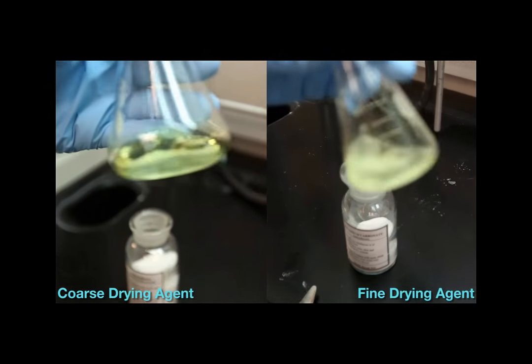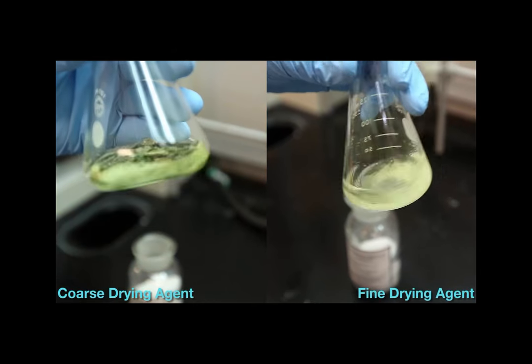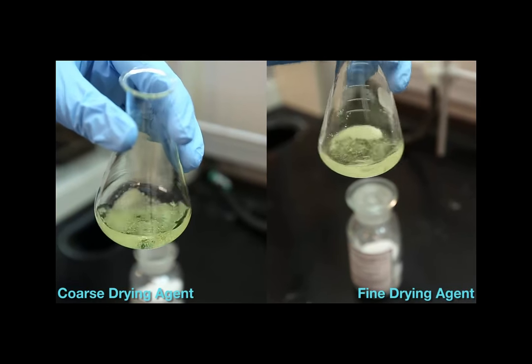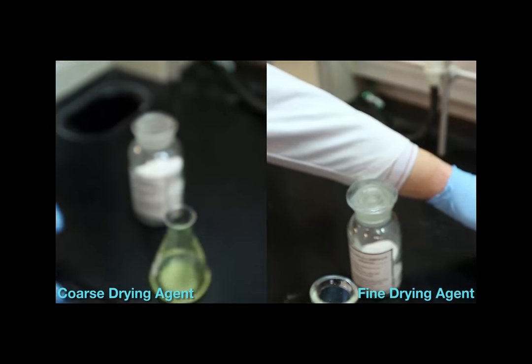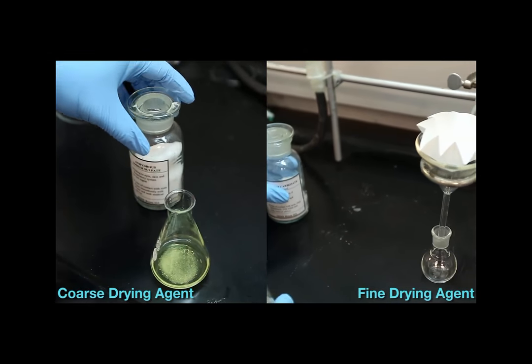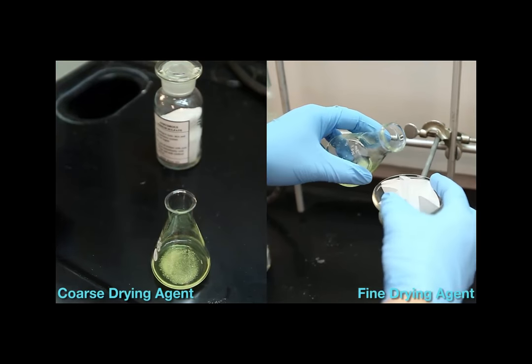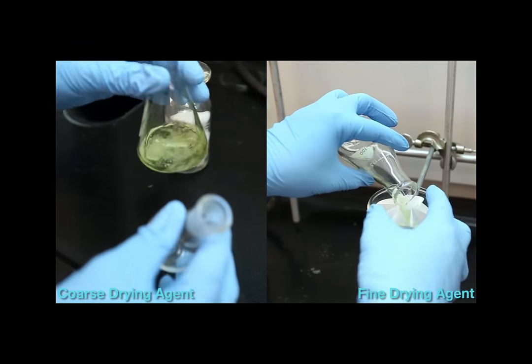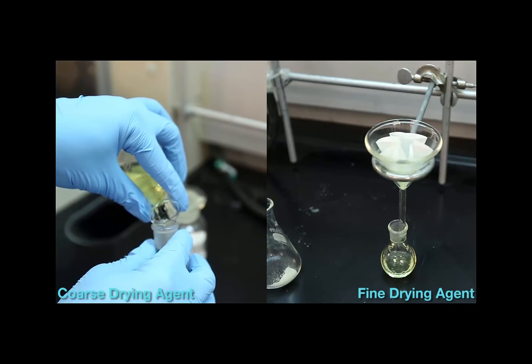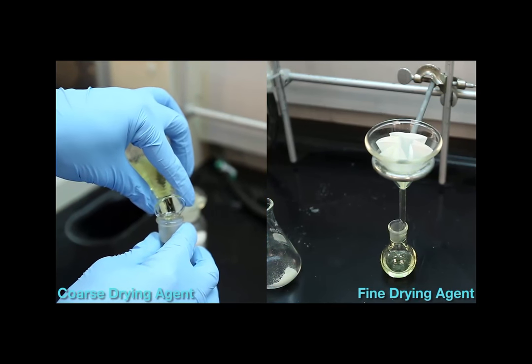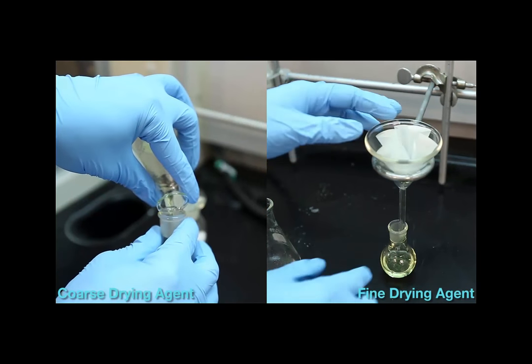Add the drying agent in, in small increments at a time. The drying process is complete when the drying agent no longer clumps. There are two precautions one needs. One, be careful not to add too much drying agent since it may absorb all of the organic solution. And two, some drying agents need a couple of minutes before they can fully absorb the water. So get into the habit of adding the drying agent, stirring, and waiting a couple of minutes before assessing the dryness.